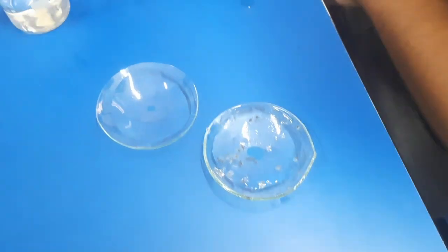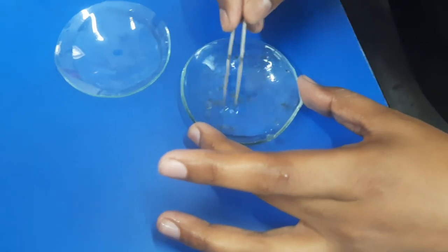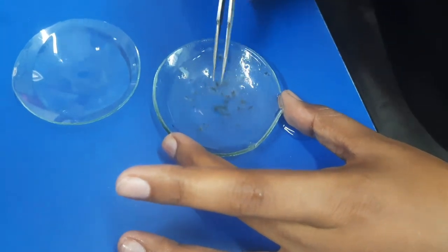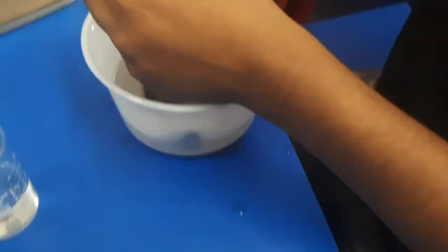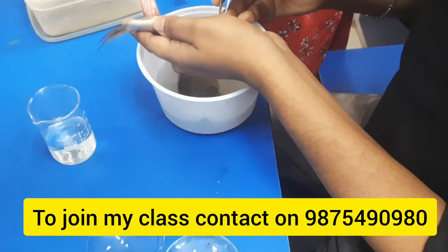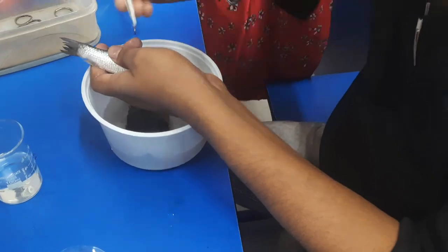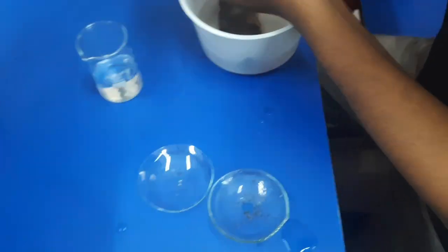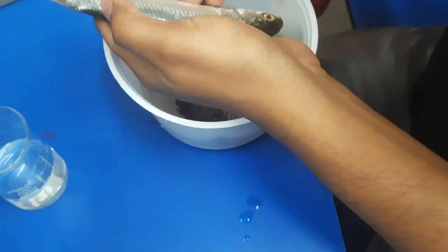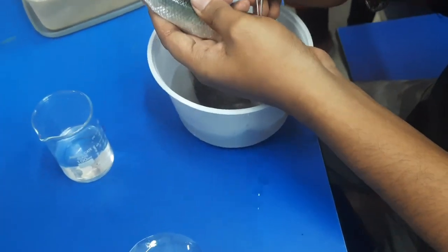Then we will add a solvent solution which will help to make the scales fully transparent. After that, the blackish pigmented area needs to be removed. In the same way, we will add a solution and then a little water.